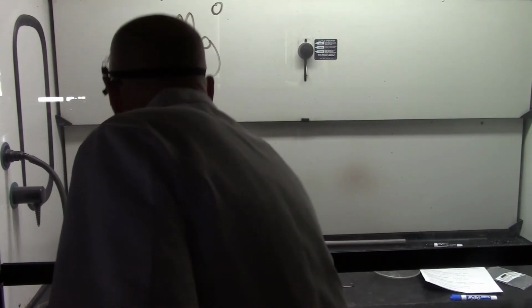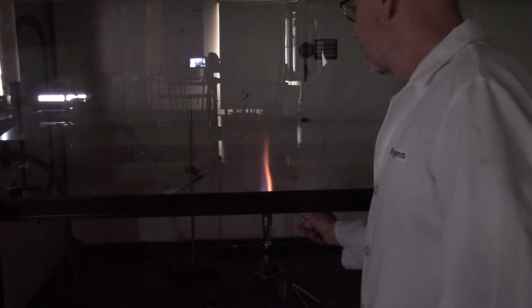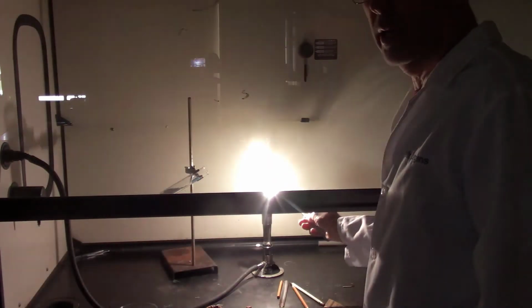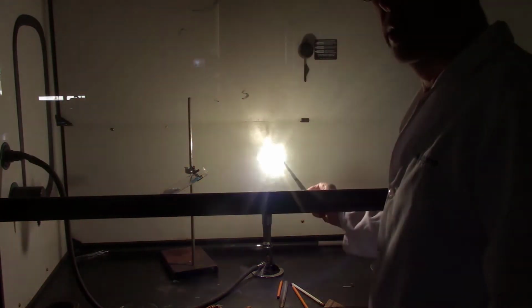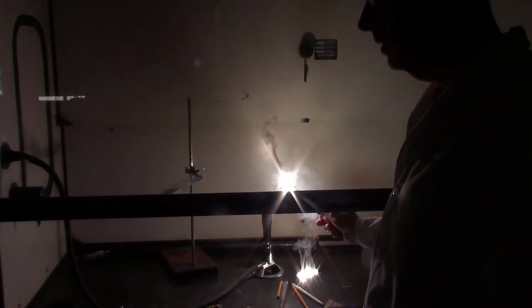I have a little hank of magnesium ribbon right here. All right. So I'm going to take the magnesium and put it in the flame for just a second, and then don't look at the flame. Oh no! It's super bright. Boy, did I ever have a disaster with a kid one time with this. Oh, it's falling on the table. All right, there's our magnesium. Let me turn the fume hood on for a second.